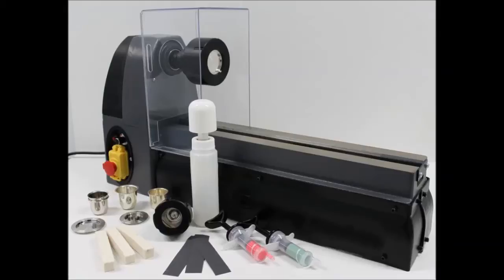The polishing lathe seen here comes with the lathe in the background, oil, a couple of felt sticks, and some grit paper and diamond paste, along with custom-made jigs.